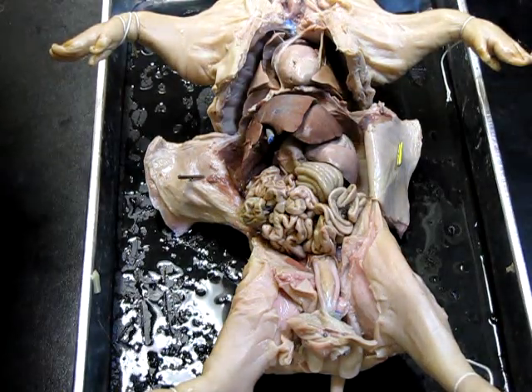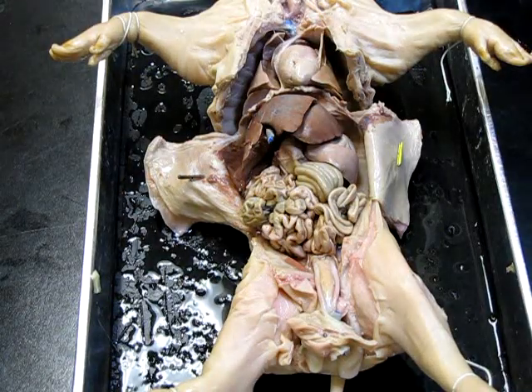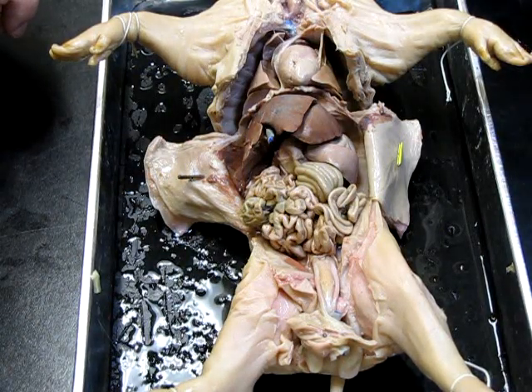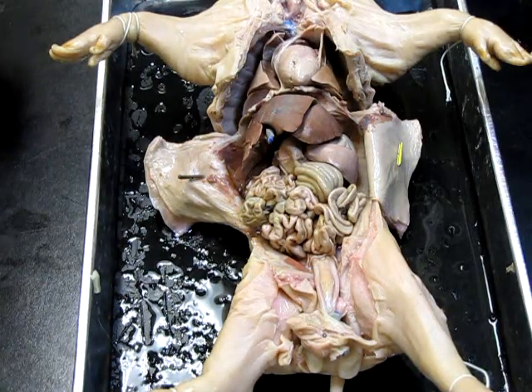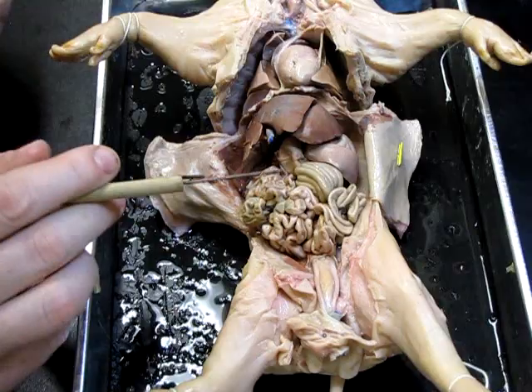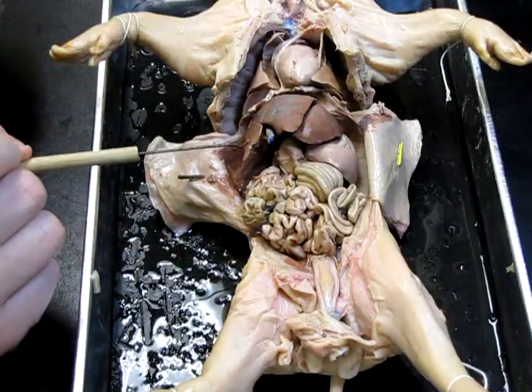We're looking at the internal structures of a fetal pig. The pigs are in the phylum chordata, the subphylum vertebrata, and the class mammalia. This is an example of a mammal. Let's have a look at the structures that we can find in both the thoracic and the abdominal cavities of this animal.